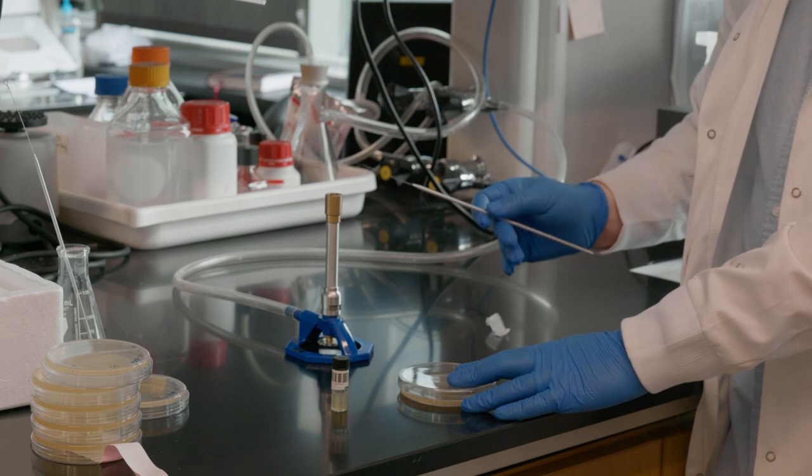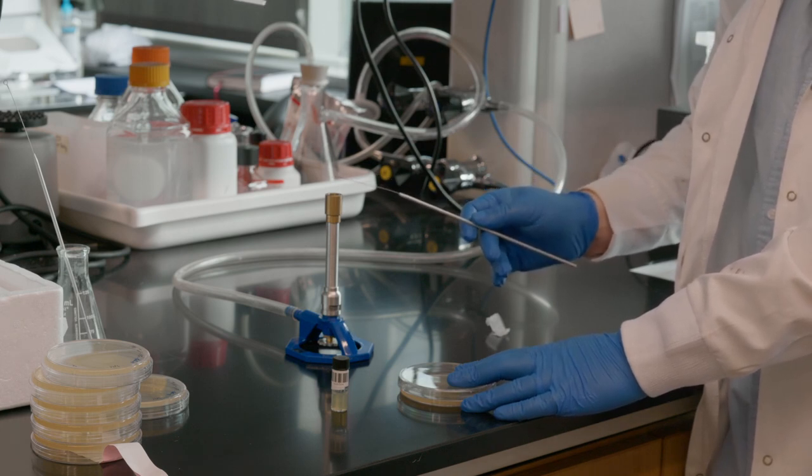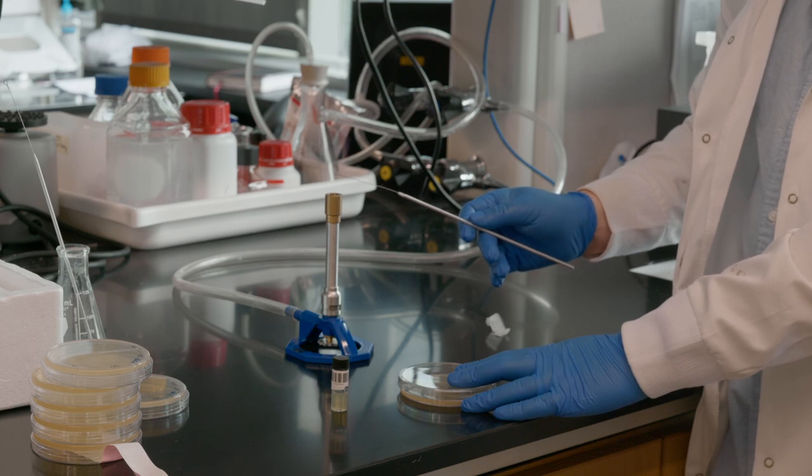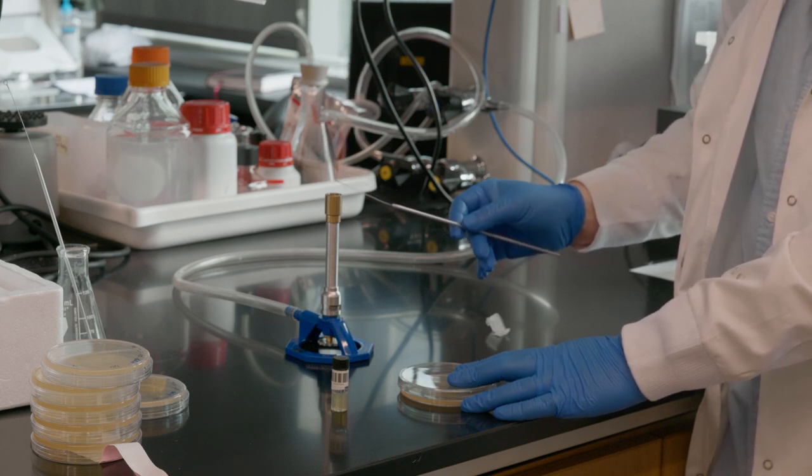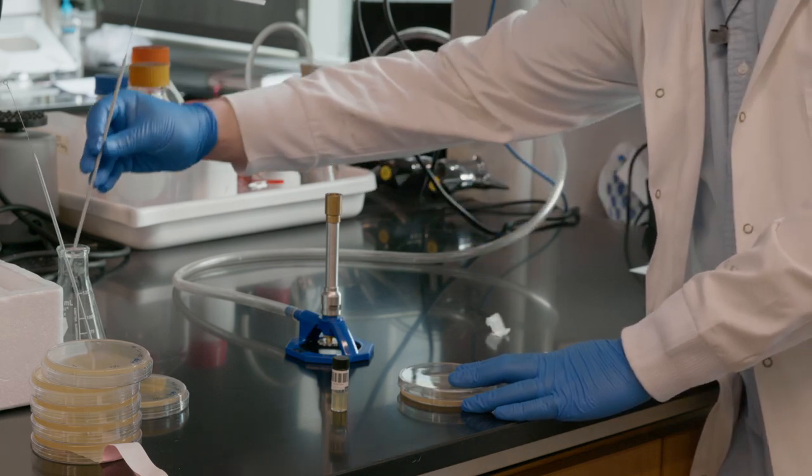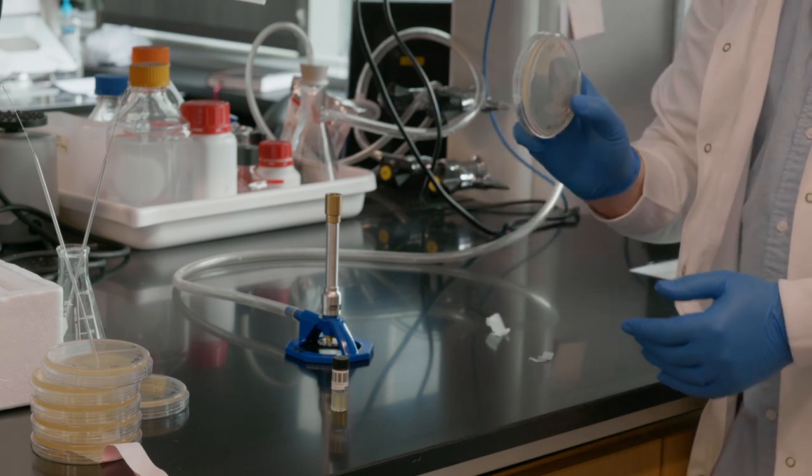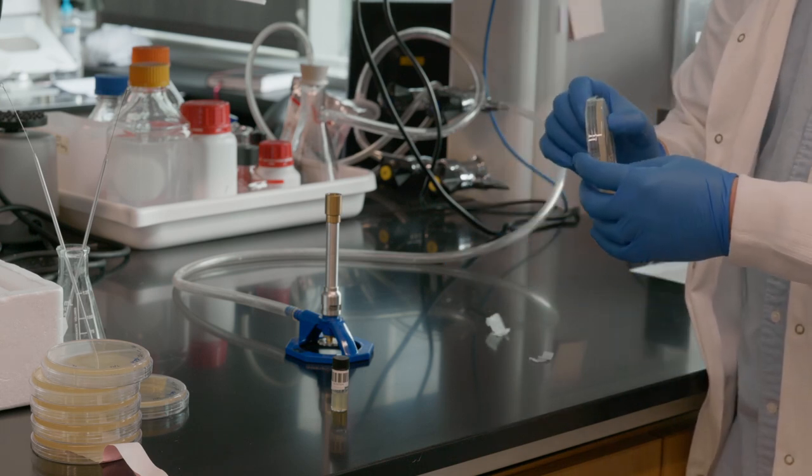We're done with this loop now. We can sterilize it and just put it back in our storage space. This is now ready to go. We're going to walk it over to the incubator.